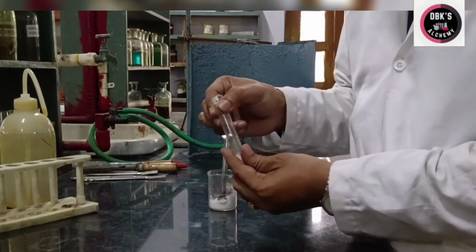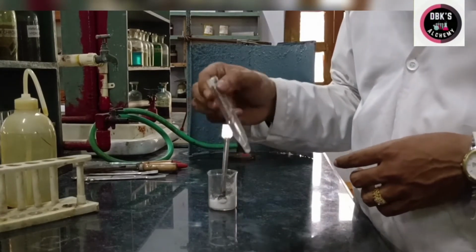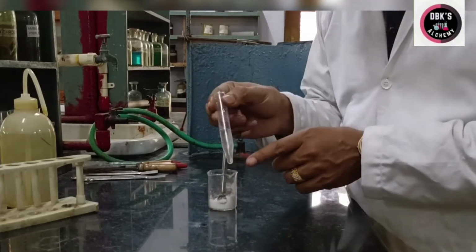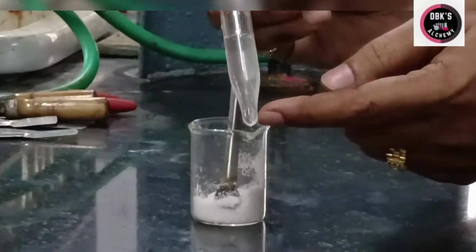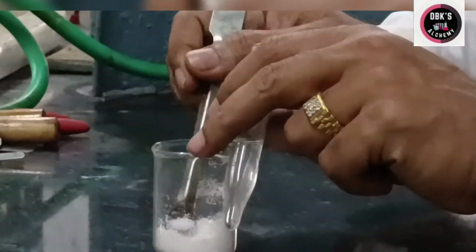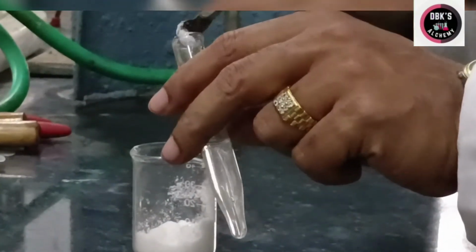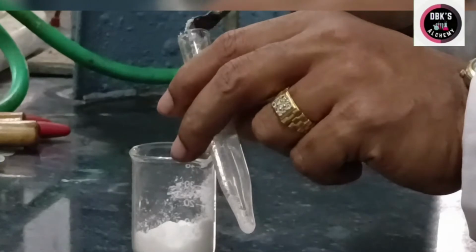Addition of ammonium chloride to the given salt solution is an endothermic reaction. As a result, if you hold or touch this particular test tube, it becomes very cool. Caution must be taken that at least little bit of ammonium chloride solid is left over at the bottom. See, I have not yet obtained saturated solution. That is the reason why I am adding some more amount of ammonium chloride solid.